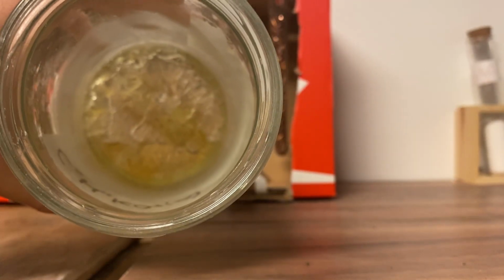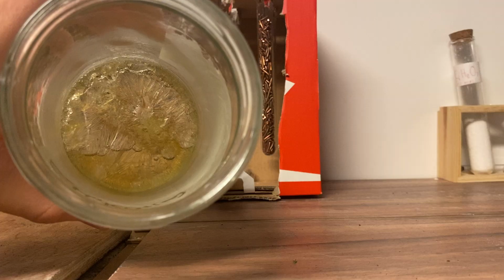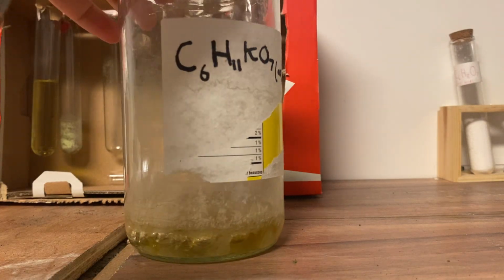If this thing would focus, there. So now it's focused. You can see some crystals. It's not fully dissolved, still a bit of liquid, but those are potassium gluconate crystals. And I just evaporated the soluble ingredients, and I basically labeled it as potassium gluconate.